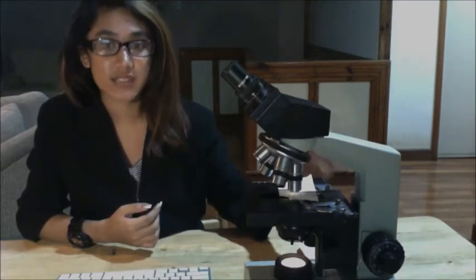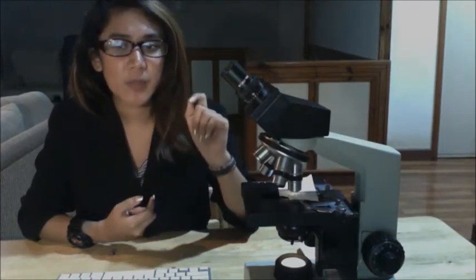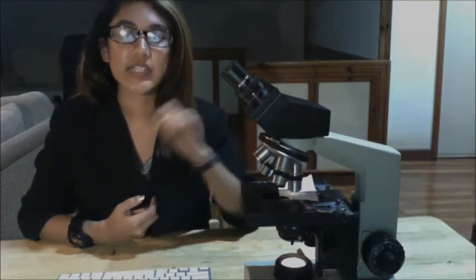For the highest resolution, place oil on the condenser lens too. Now adjust the fine focus, the diaphragm, and then the stage as described in step 12. With the 100x magnification lens and the 10x eyepiece, the total magnification is 1000-fold. Note that you will not want to look at every specimen with the oil immersion lens. Why? Because some specimens are too big to be seen clearly at this magnification.